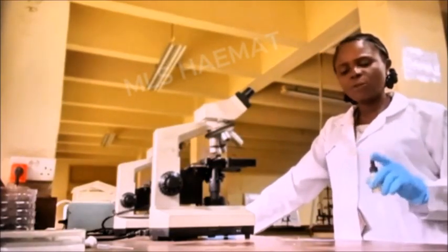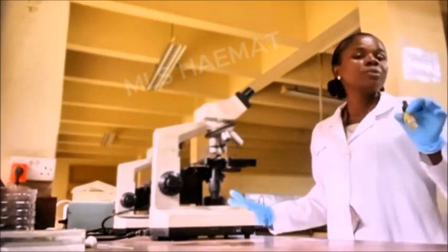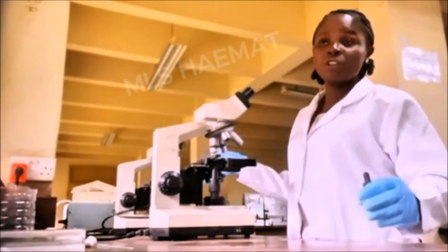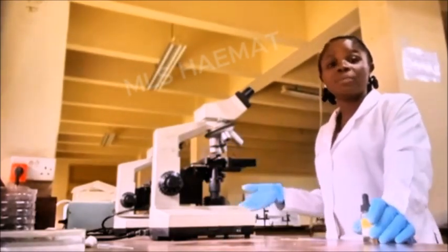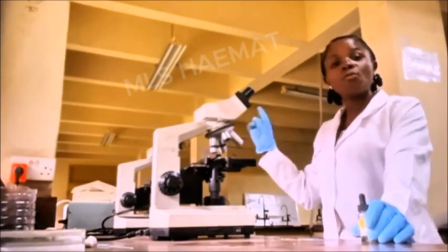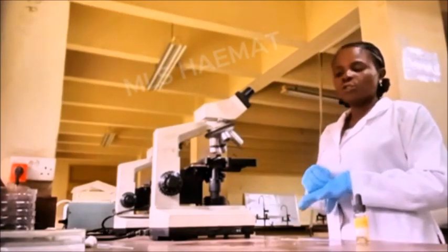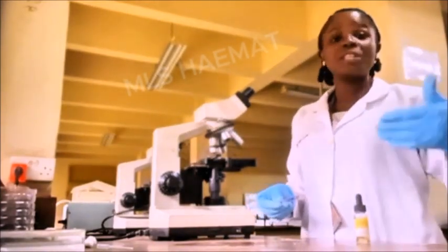So today I'm going to be showing you how to focus with the oil immersion objective lens. I've already taught you in my previous video on the different parts of the microscope, so you know about the oil immersion objective lens. But if you don't know about it, please feel free to go back and watch that video on the different parts of the microscope. So, how do you focus an object with the oil immersion objective lens?